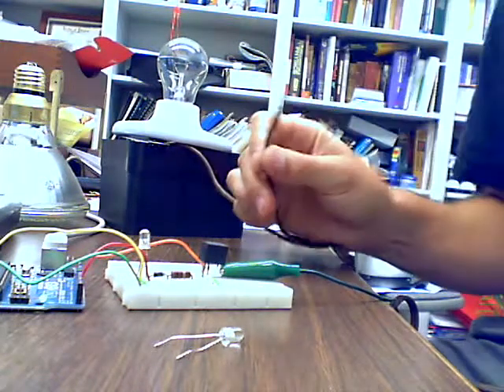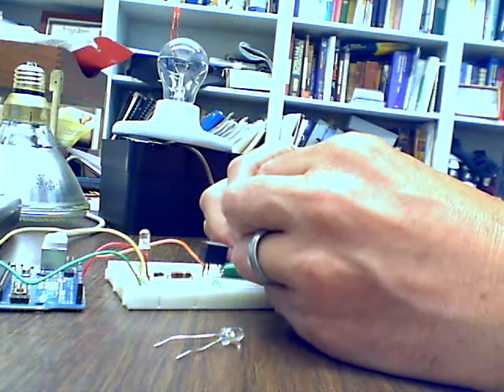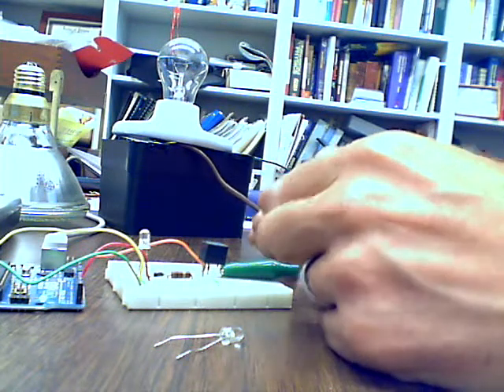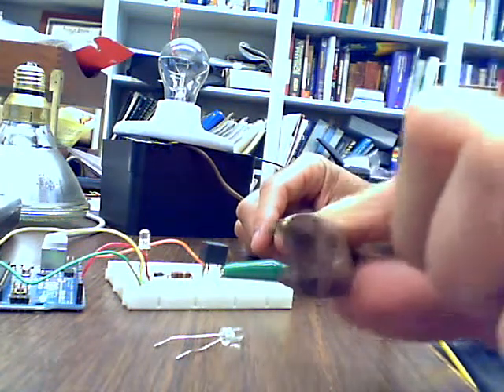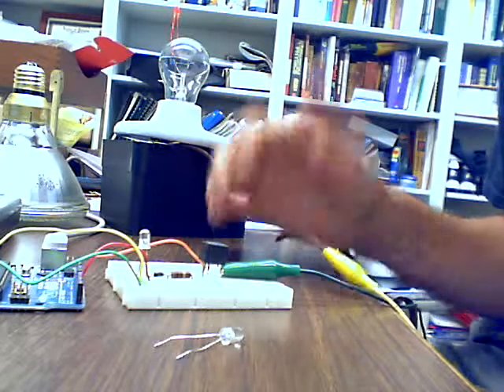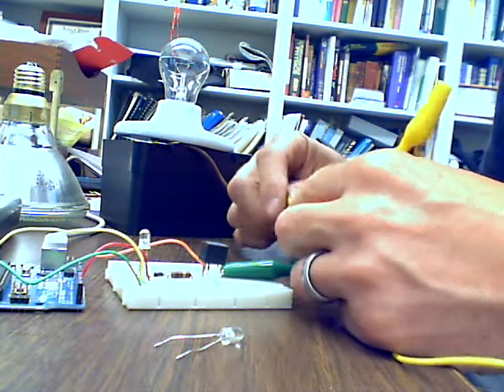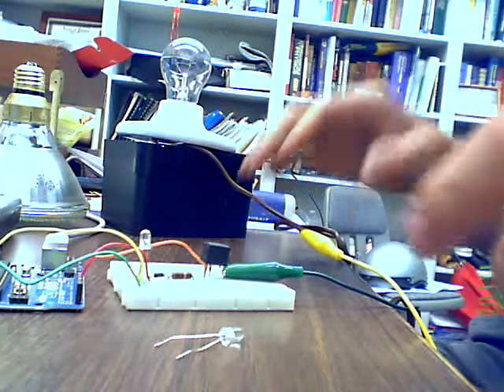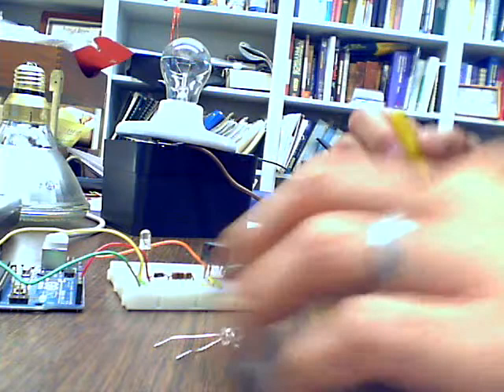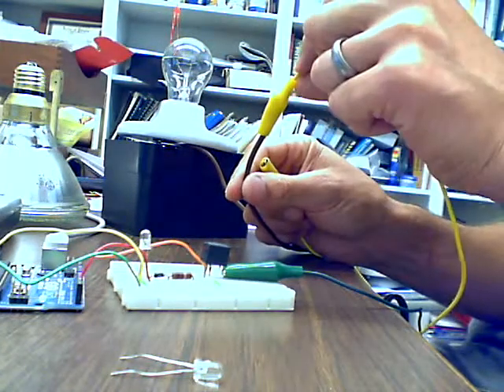I'm then going to take a yellow alligator clip that I'm thinking of as my hot wire, even though, again, I haven't made any distinction with my lamp cord which one is hot and which one is common, so there's technically not any difference. It's just so that I can keep my color code in here. The whole thing will be hot once the light is plugged in, so you don't want to touch any of the wires. You want to make sure that you make connections that don't have exposed wire.